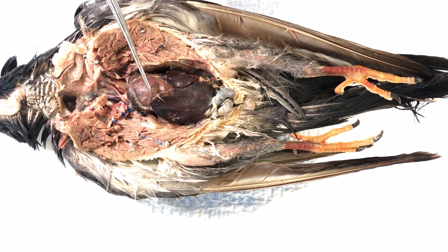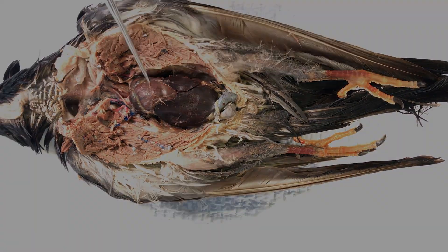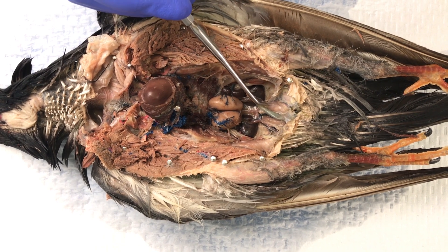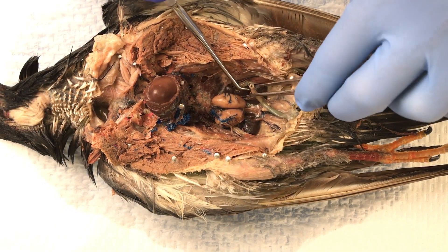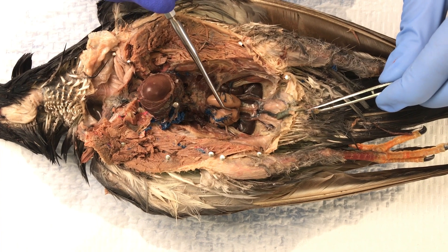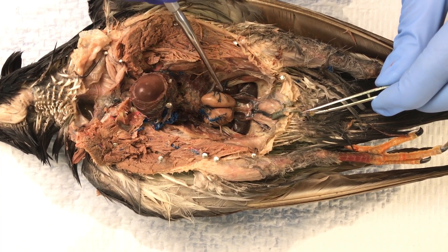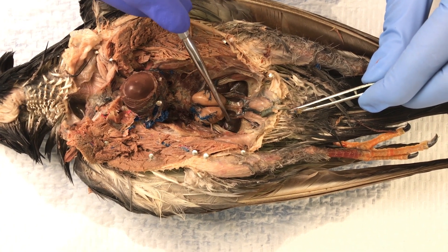If we remove these structures, we can more clearly see the urogenital features. Here we have a male. We can see the rectal ceca, and moving that out of the way, you can see the testes of this male and the kidneys embedded in the back body wall of the animal.